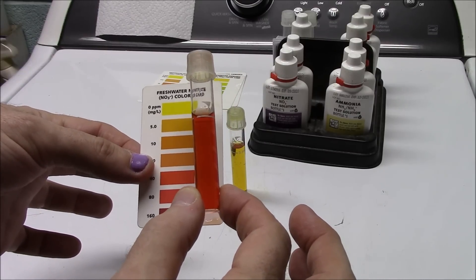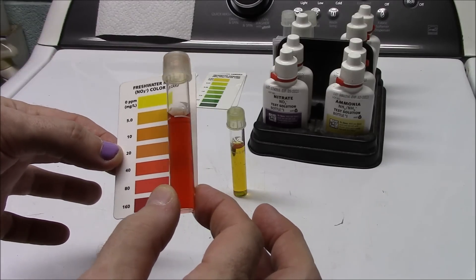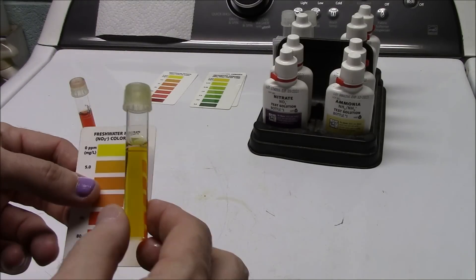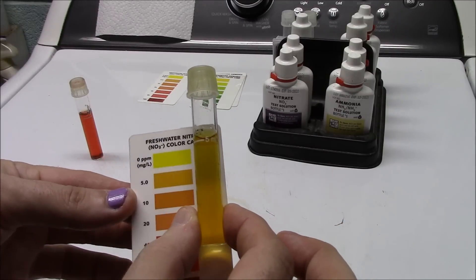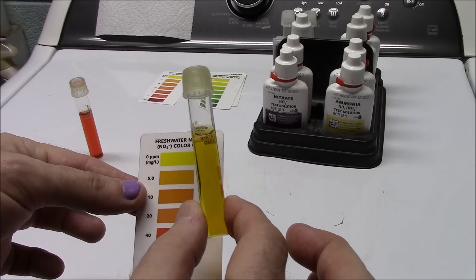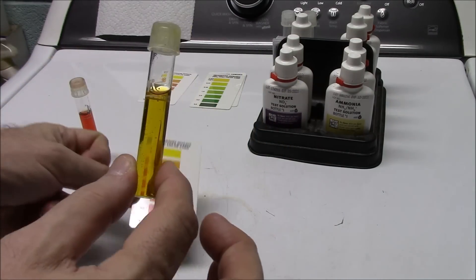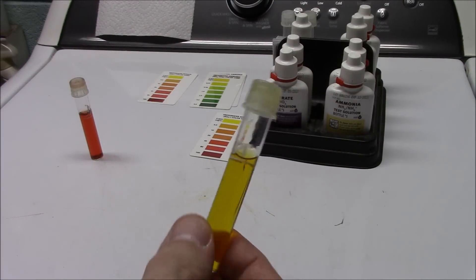This test is from my T-bar tank a few days later, and we're probably sitting at about 40 parts per million — it's time to do a water change, not urgent but it is time. This is my tap water tested again today — we let the vial bloom for the full five minutes and you can probably tell it is not yellow; it does have a little bit of brown to it. So I do indeed have a little bit of nitrates coming through in my tap water, but not much. I've seen this vial come out red from my tap before. You want that space in between — not right up against the paper.